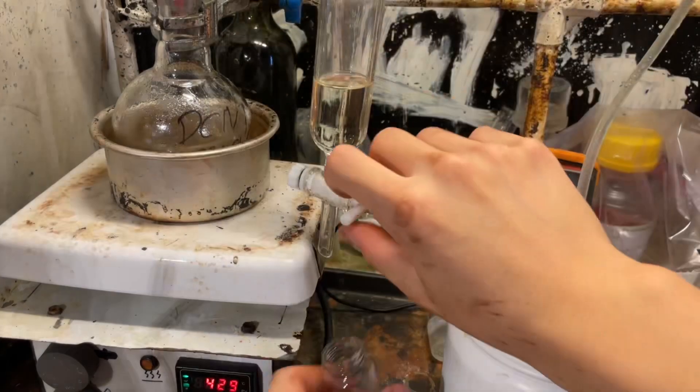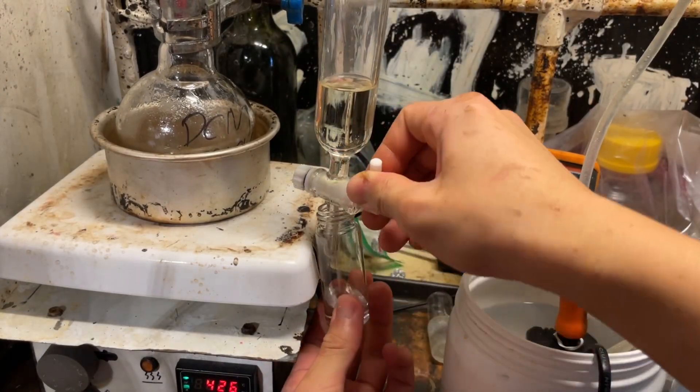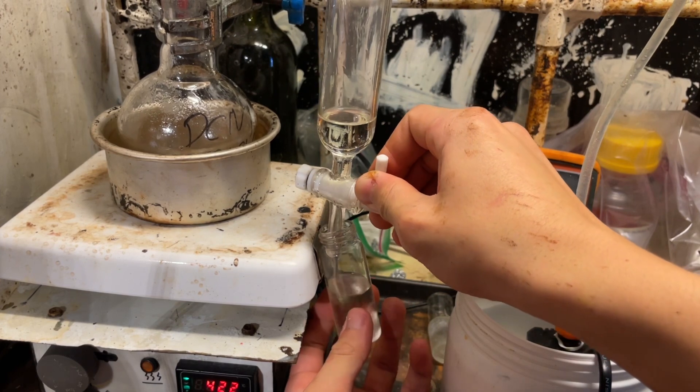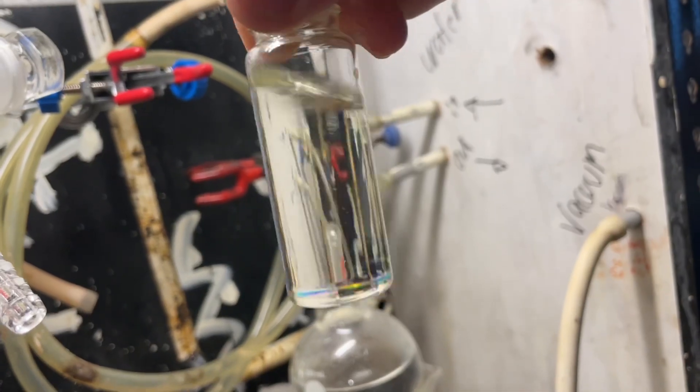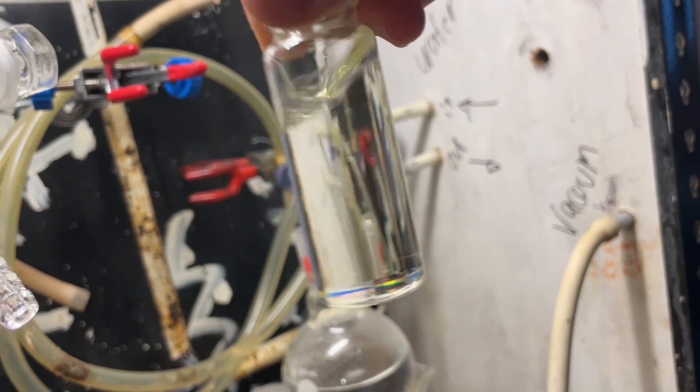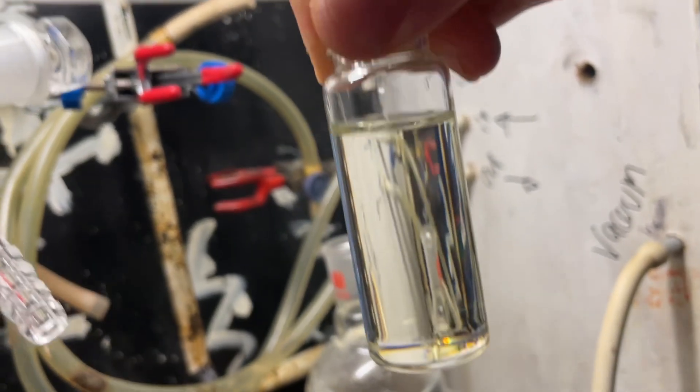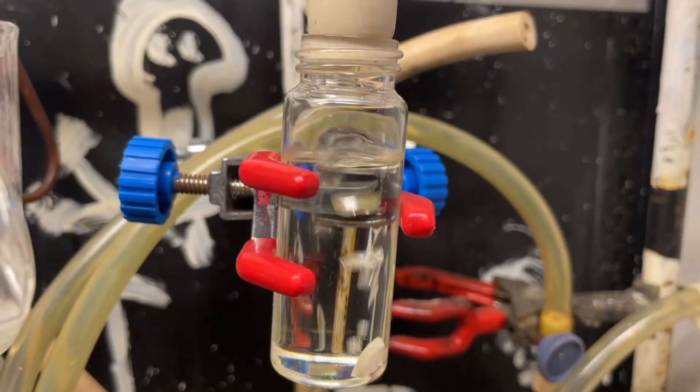It's quite refractive, and after leaving a tiny bit of residue in our flask, because you do not want to distill the yellow over, I simply took it out of the setup, and here it is. It has a tiny bit more dichloromethane, of course, because I left some with it. So, I'm going to strip most of that off under a vacuum.